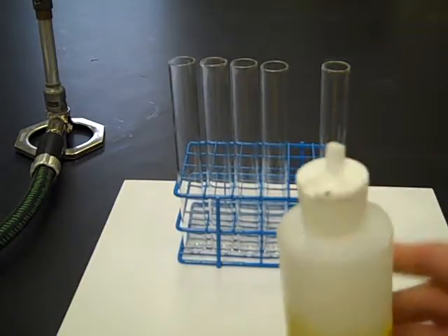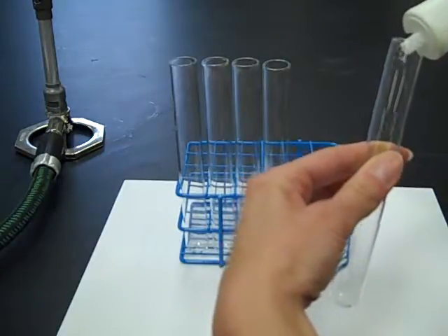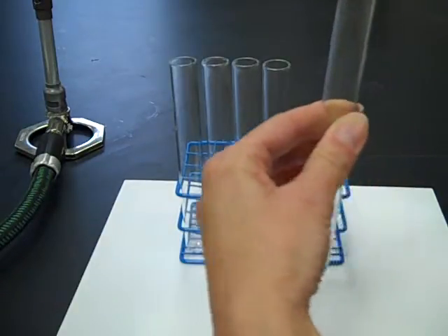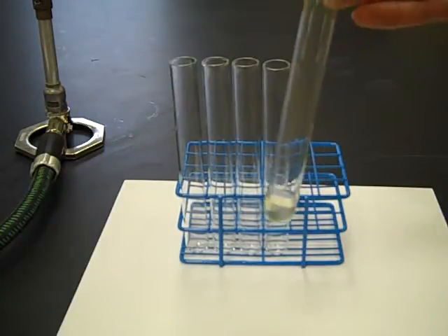Here in this test tube, we're going to add egg albumin. This test tube is going to be our untreated control. We're going to compare everything to the control.